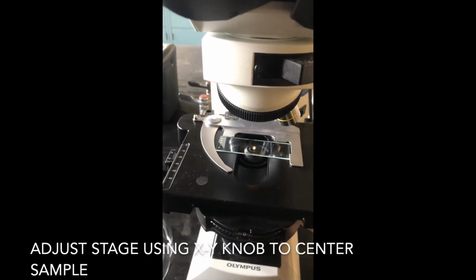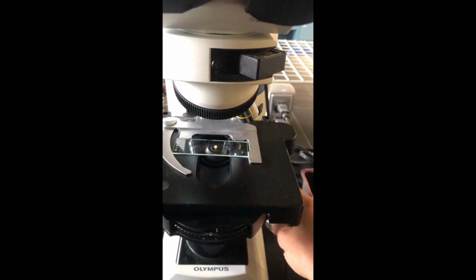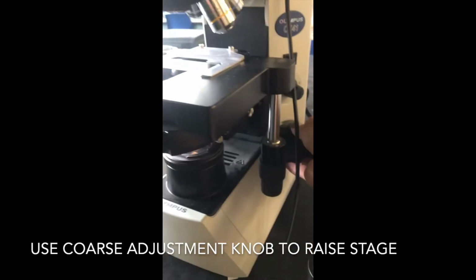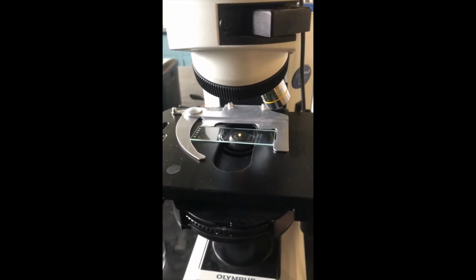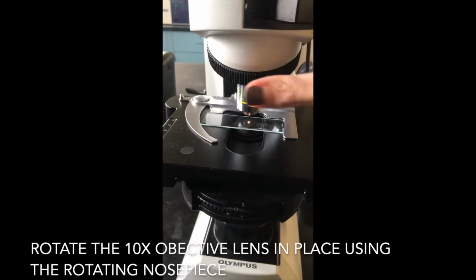We then adjust the XY adjustment knob to center the specimen on the stage so that the light is shining directly through it. We then use the coarse adjustment knob to raise the stage to the highest setting. Next, we rotate the objective lens into place using the rotating nose piece. You want to make sure you hear that 10x objective click into place.